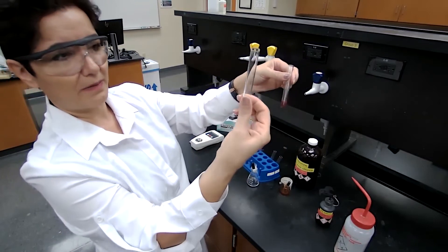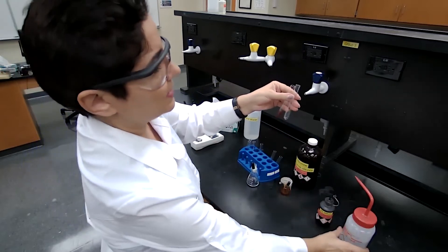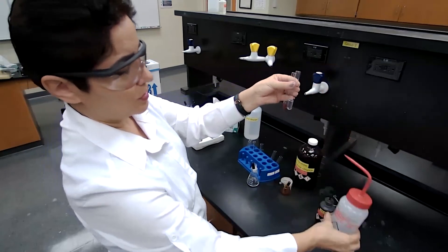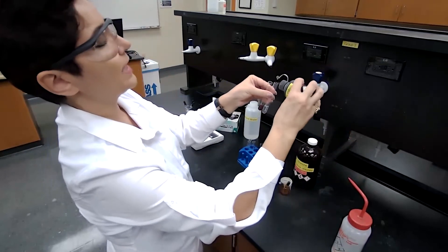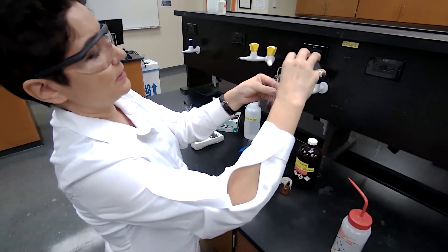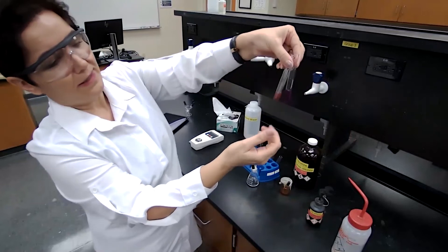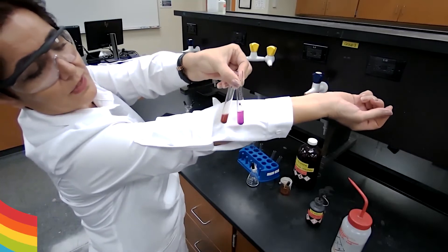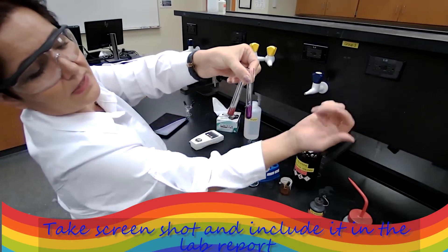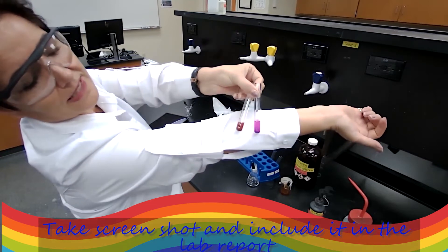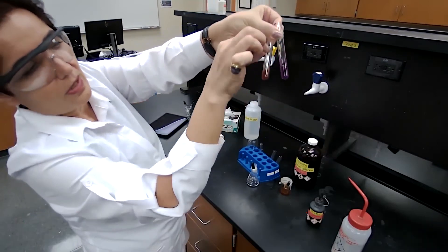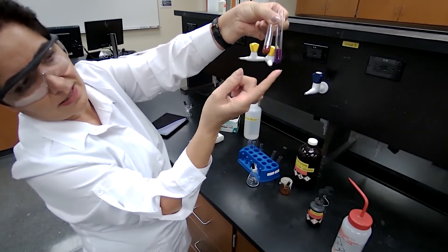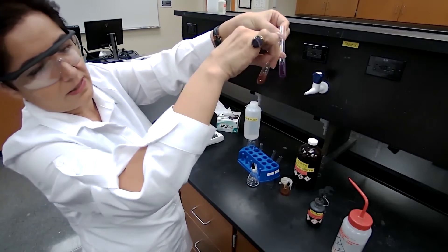I'm going to make a blank sample with just the acetone and the permanganate so you could see the purple color when there is no C=C double bond, how would it look like. With this comparison, now you can see clearly that there is a color change. You want a white background to see that color better. This is the blank sample and that's our test solution, and also the residue of the manganese dioxide is precipitated in the test tube.